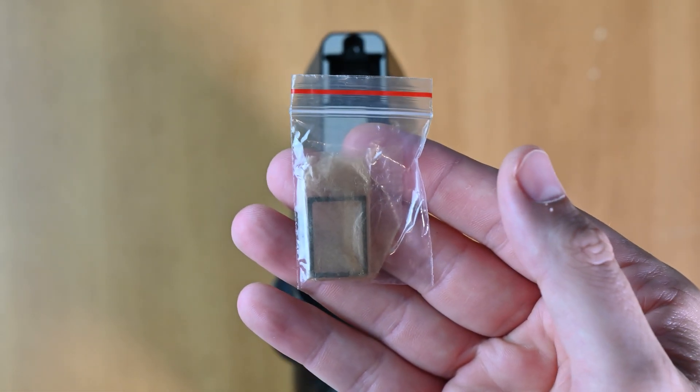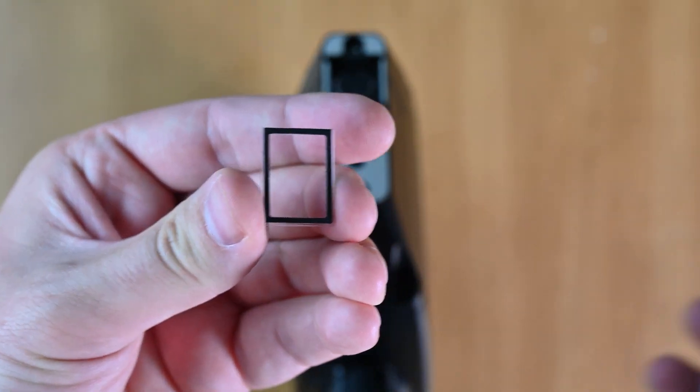But for this video, we won't show just pop in a new one of these in. You'll be able to see this one come right back inside.